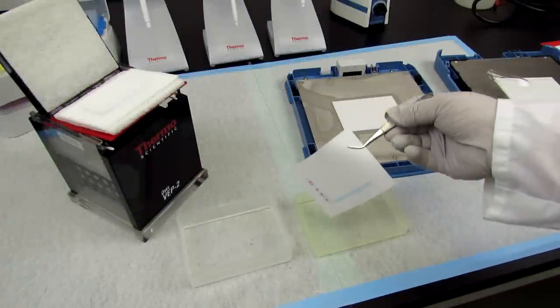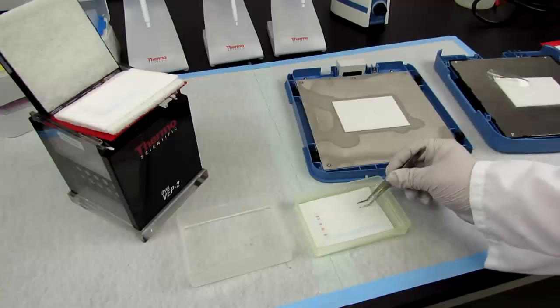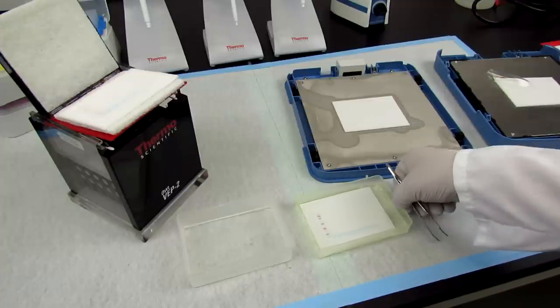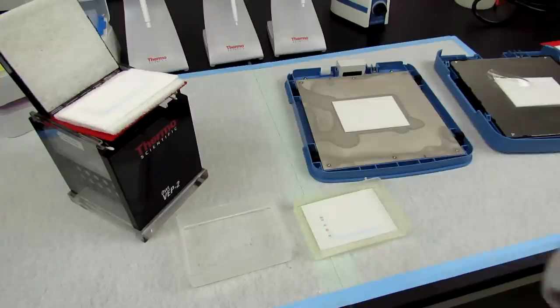After Western blot transfer is completed, the membrane undergoes a series of incubation and wash steps to prepare the membrane and probe it for your target protein.